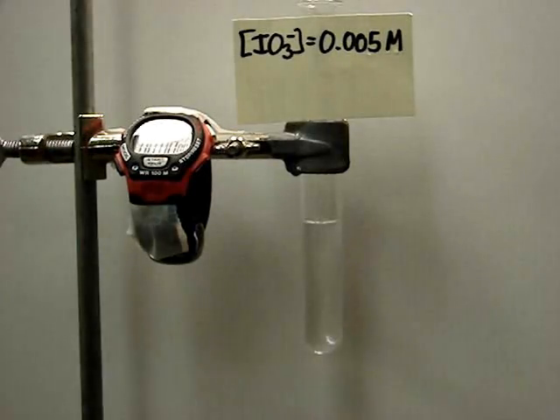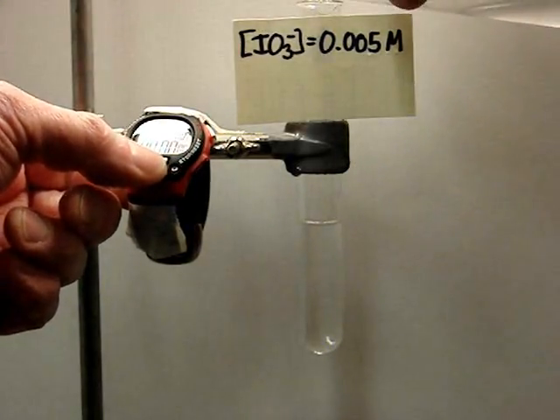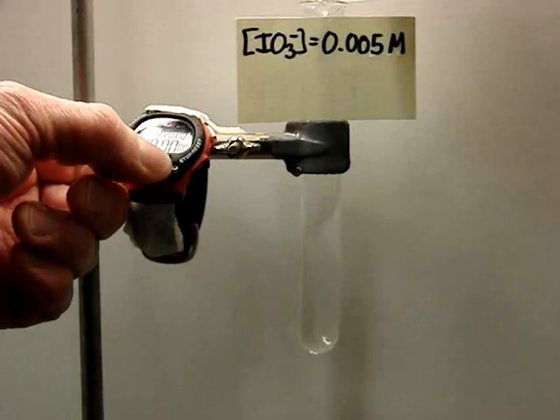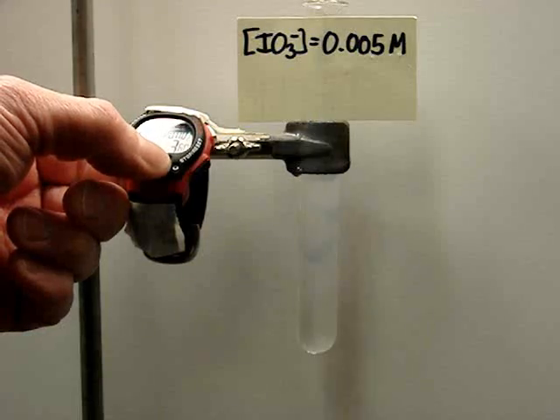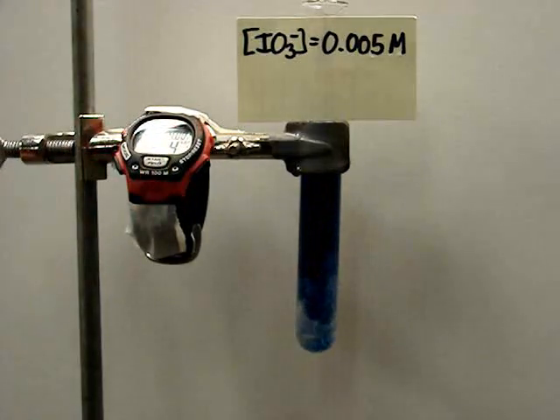0.005 molar. About four seconds this time.